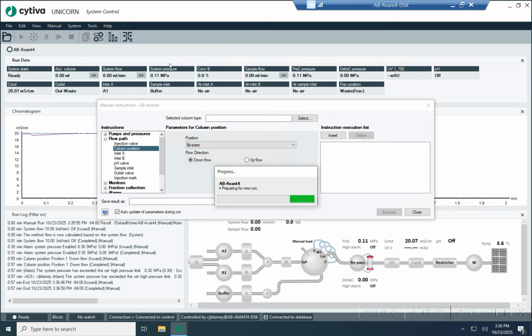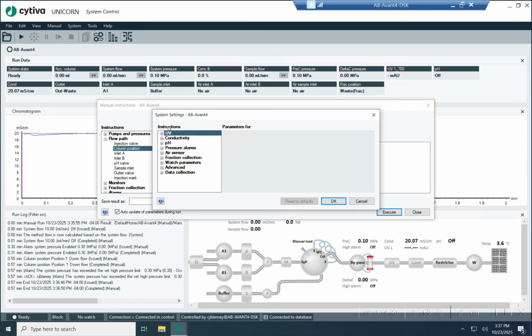And the reason I'm going to end the run is because I want to show you guys the settings. You can find settings in system and then settings right here. The thing about settings is you can only change settings while the system is in a ready state, so that's like the gray state right here, right? And I can't change it while I'm doing a run.